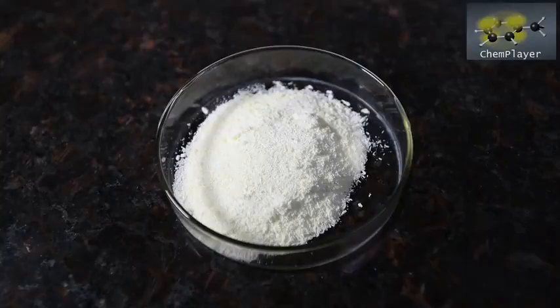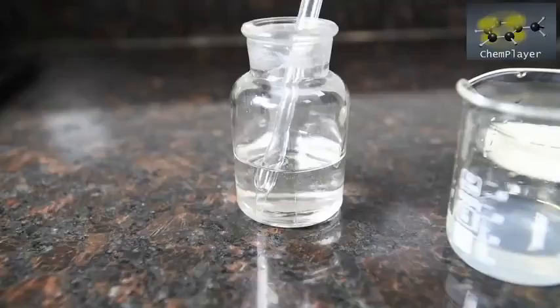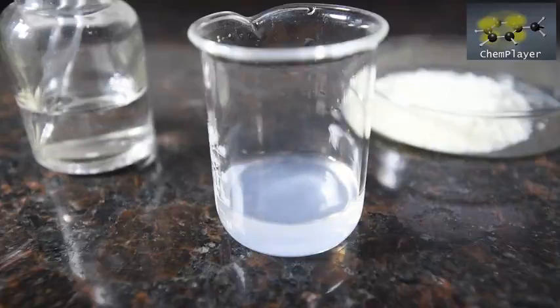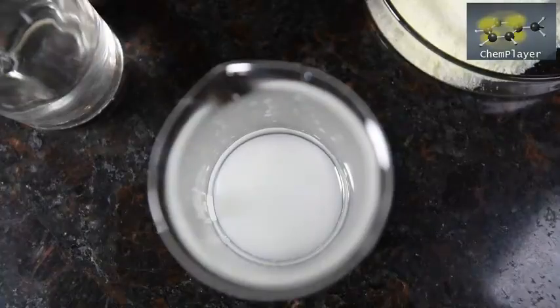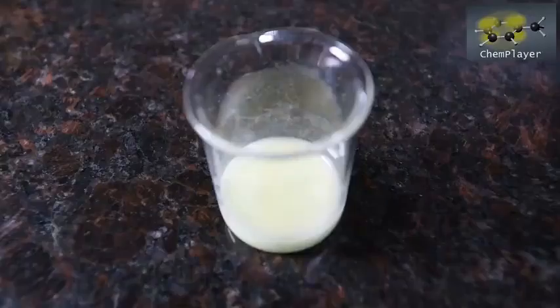We got a new lens so we'll now be doing close-up macro shots from time to time. Let's do a classic test for thiosulfate: dissolve the product in a little cold water — very soluble and no residue. Here's some dilute sulfuric acid. To begin with nothing seems to happen, but then a milkiness appears and grows stronger, and after a minute there's a strong precipitate of yellow sulfur. Thiosulfuric acid is formed as an intermediate species, but this is unstable in contact with water and breaks down to form elemental sulfur again.